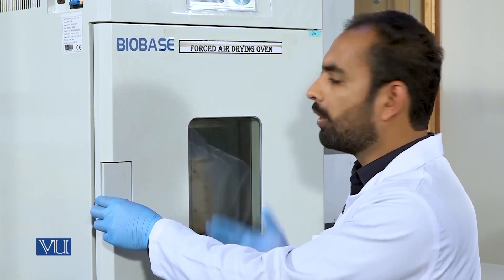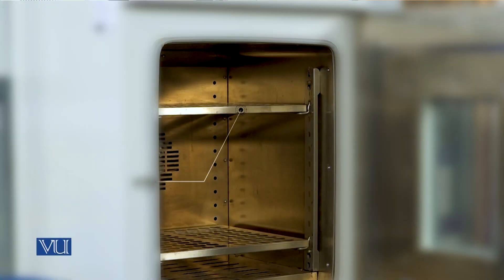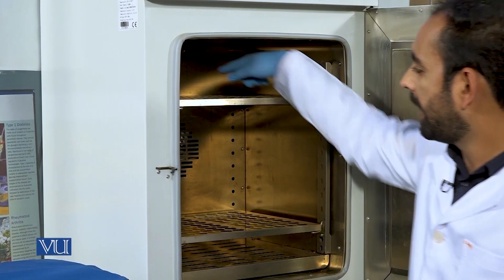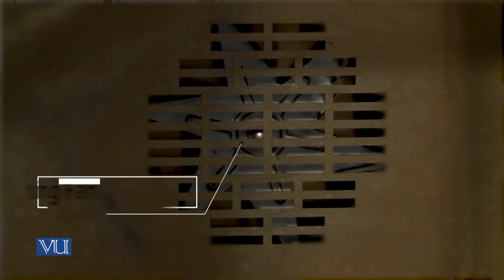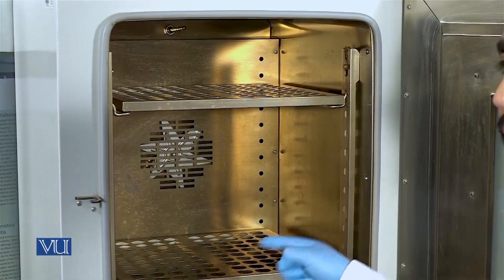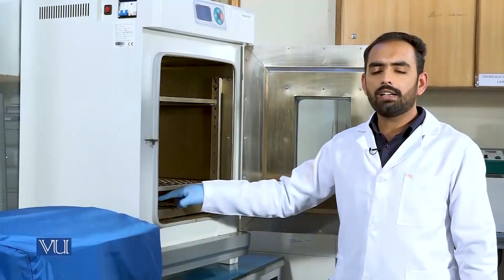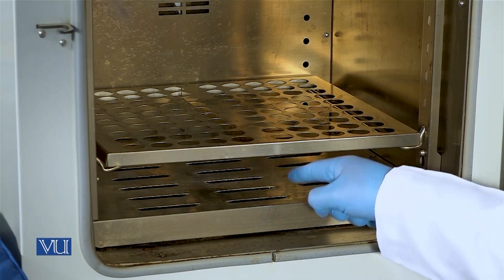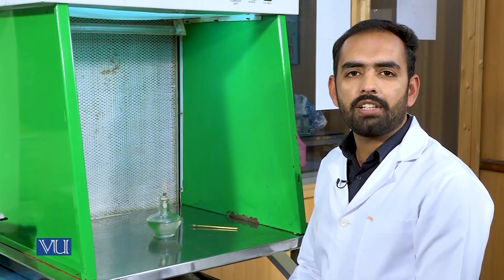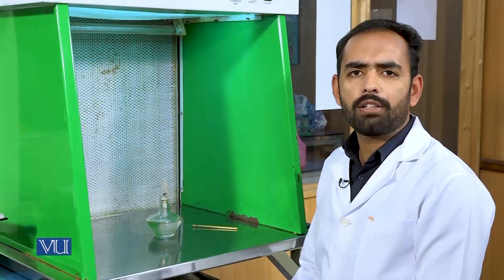Now let's talk about its construction and operation details. Hot air oven comprises of a door, shelf, a thermostat, and a circulating fan. Hot air oven is an insulated chamber in which electrically generated heat is confined. The circulating fan helps to distribute heat thoroughly into the chamber. Electrical coils for heat generation are located at the bottom of the hot air oven.